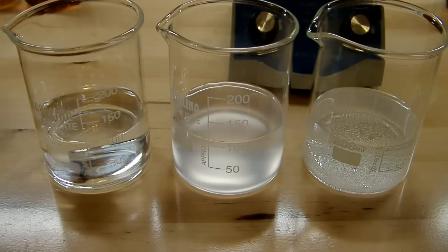Hey YouTube. In this video I'm going to be doing the classic Briggs-Rauscher iodine oscillating reaction. This is actually a highly complex reaction where as many as 30 different things can be happening simultaneously. I have a paper that claims 30 things are possible but they've narrowed it down to maybe 11 or 12 that are necessary for the reaction to work.